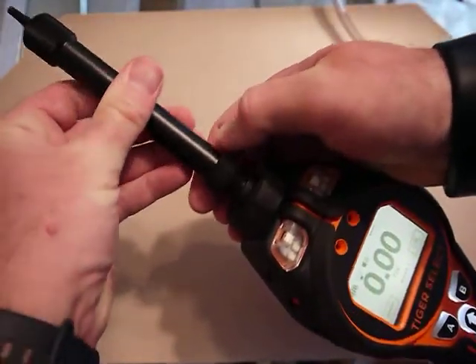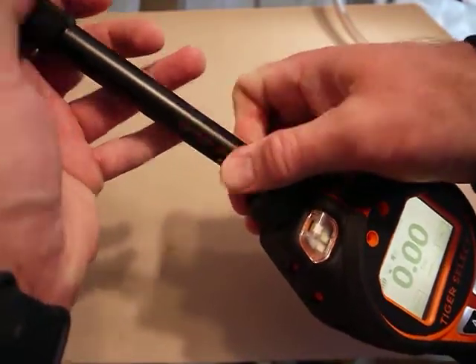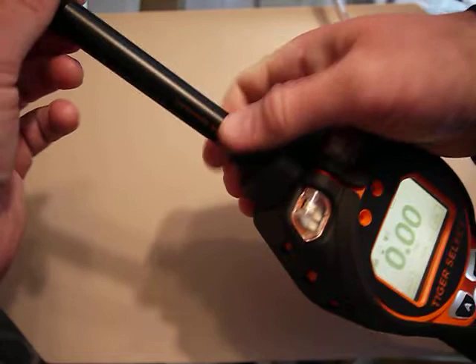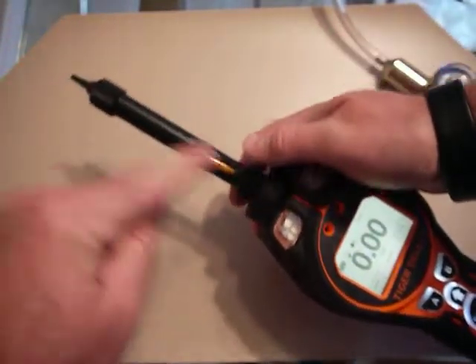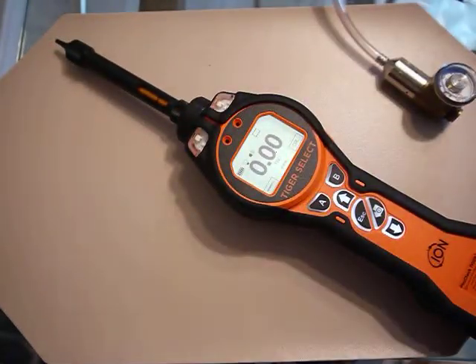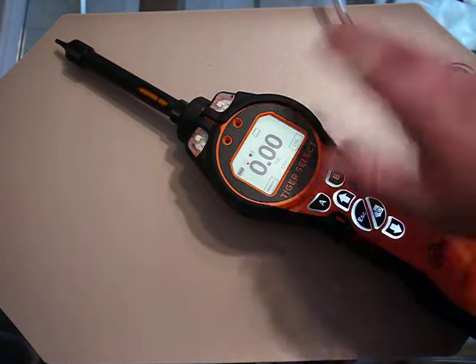I've used the tube breaker — I covered that in a separate video. I want to make sure this is tight, because we want to make sure that all the gas comes in, goes through, and gets measured.